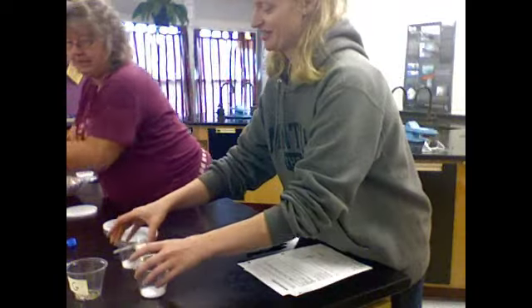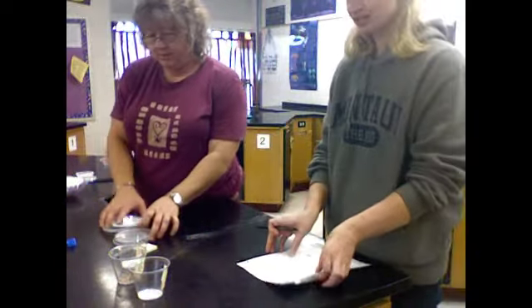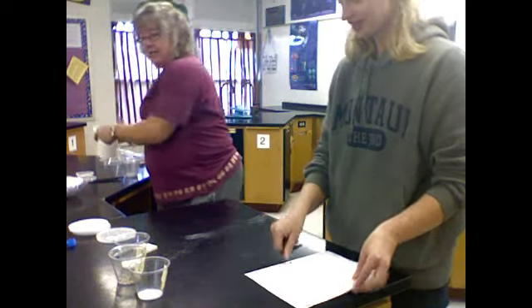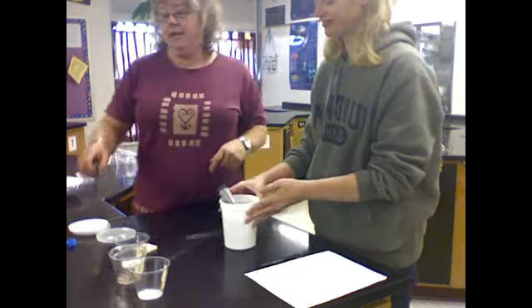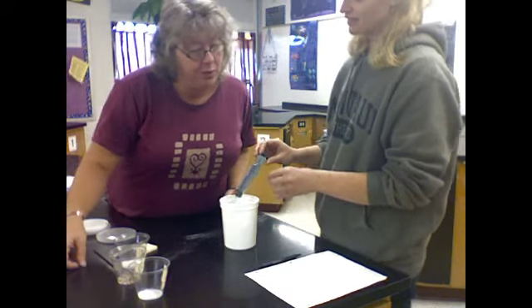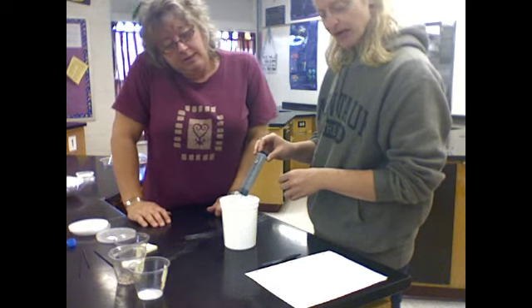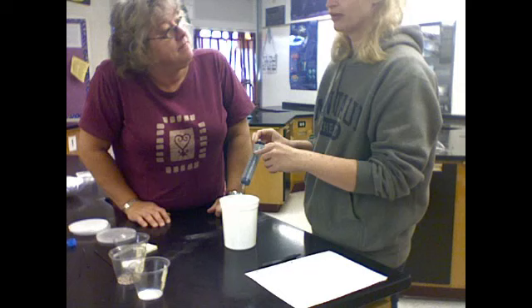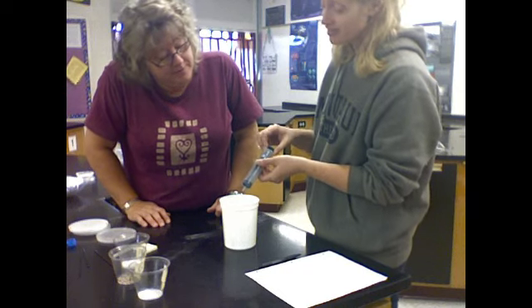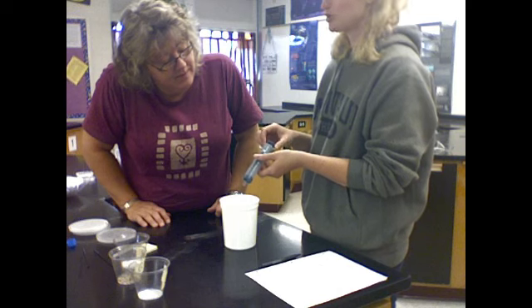So I just happen to have a syringe here, Ms. Stilton. Wonderful. And so what do you want to do first? Well, it says you wanted to do the gravel and water first, and I will note that our syringes have what I call a screw in them to help stop you exactly at 50 mLs, because otherwise some people might not measure exactly. I love these. I call them foolproof. Not that any of us are fools, but it takes the guesswork out of it.